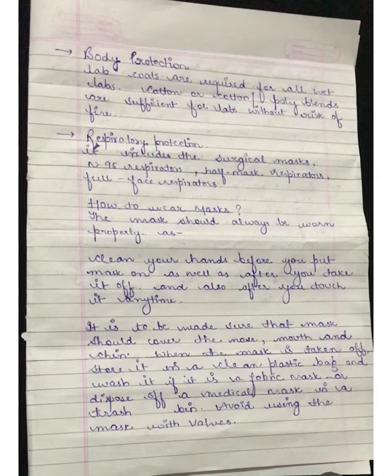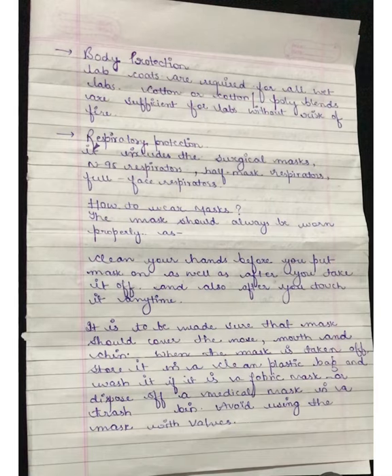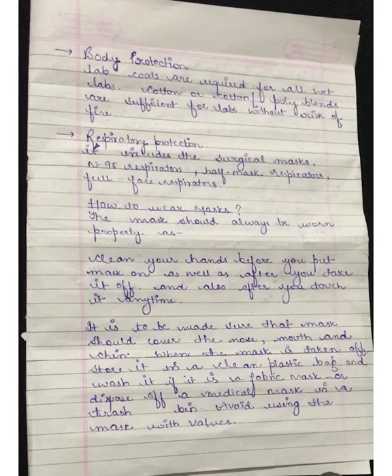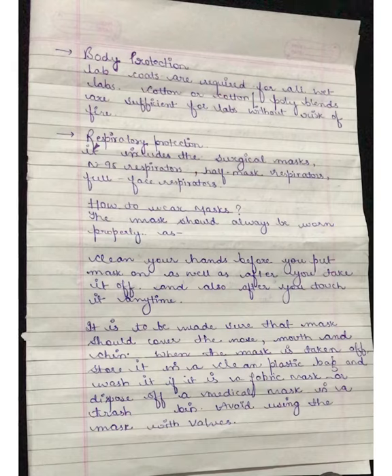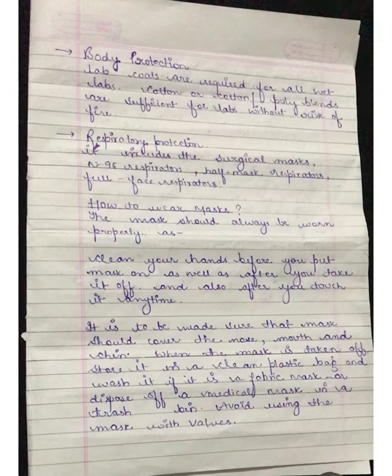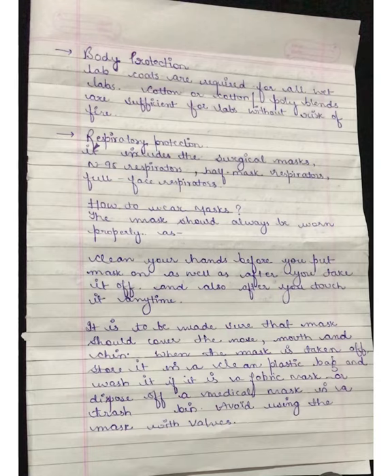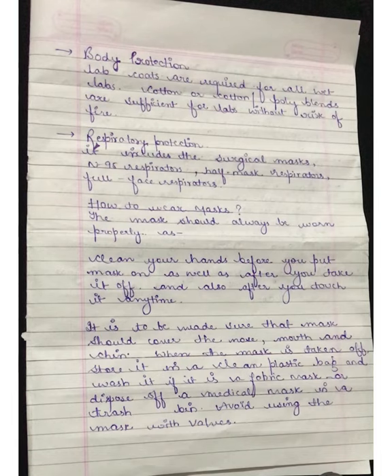It must be ensured that the mask covers the nose, mouth, and chin. When the mask is taken off, store it in a clean plastic bag. If it is a fabric mask, wash it; if it is a medical mask, dispose of it in a trash bin. Avoid using masks with valves. Disposable masks should be disposed of, and reusable or fabric masks should be washed very properly.